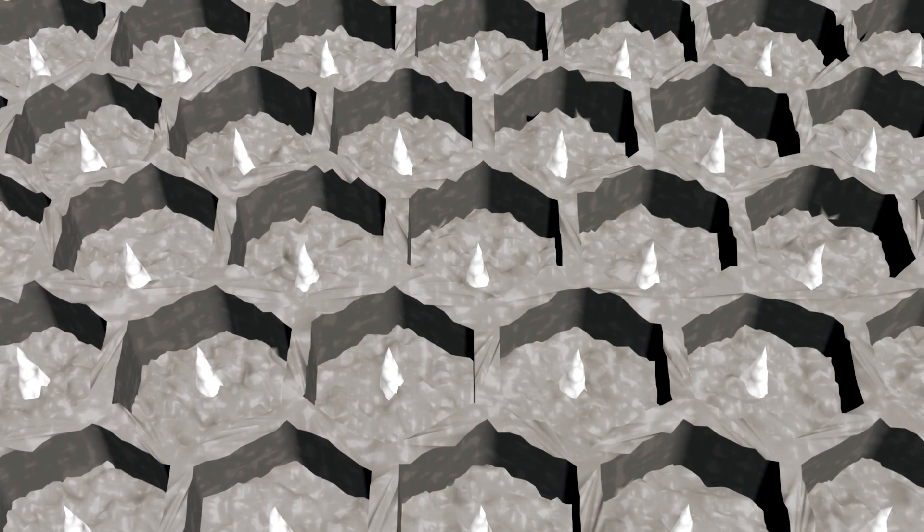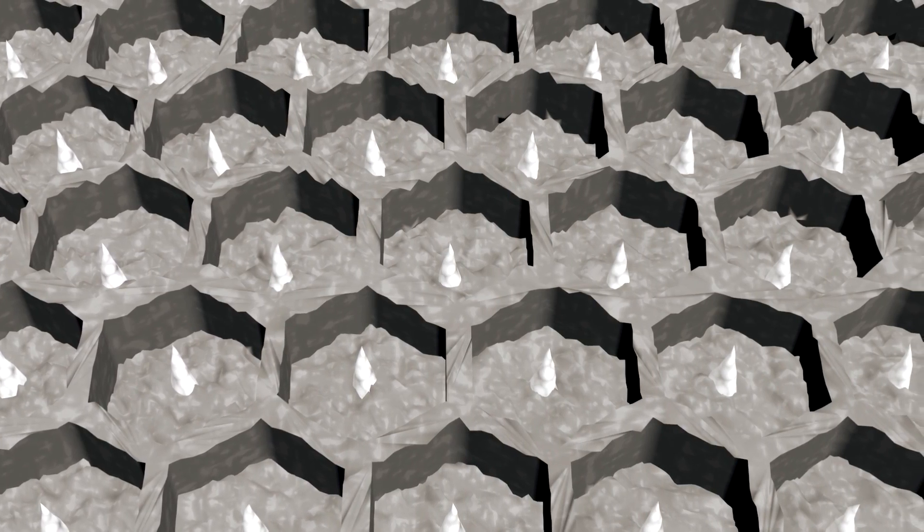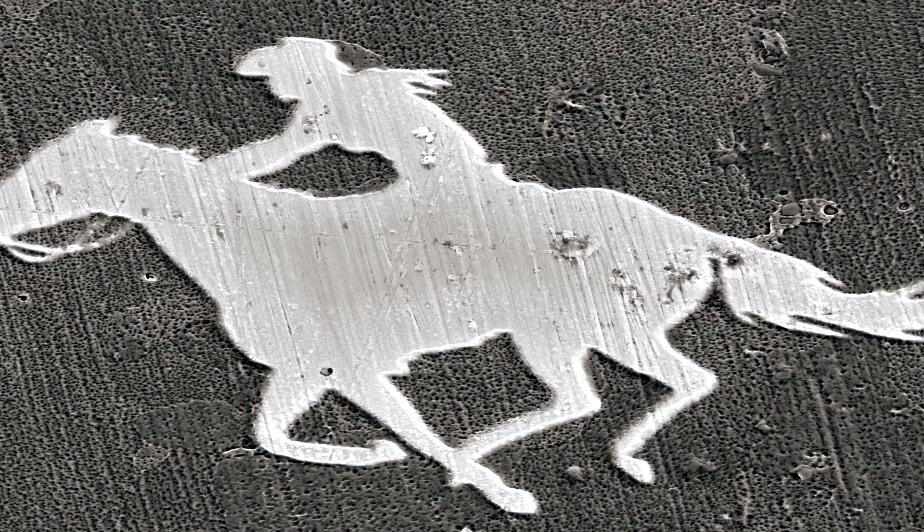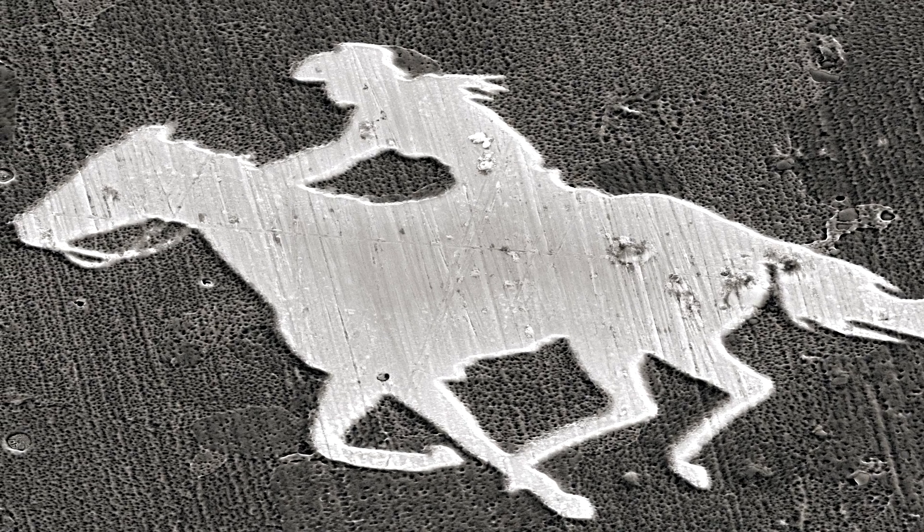Is there something more that could be done with the ion gun? Well, the focused ion beam can also be used to create microscopic structures for a variety of applications, like creating nanopatterned surfaces for scientific experiments. However, the ion gun can also be used for making a special birthday present, or even for creating a truly unique logo for your company.